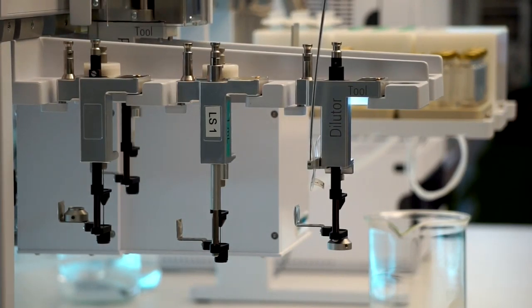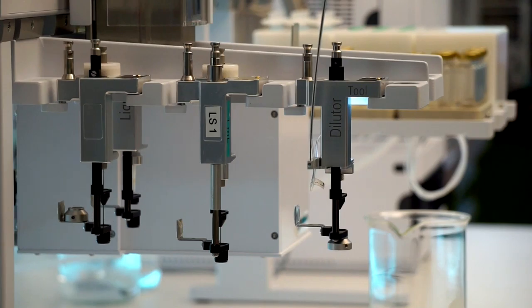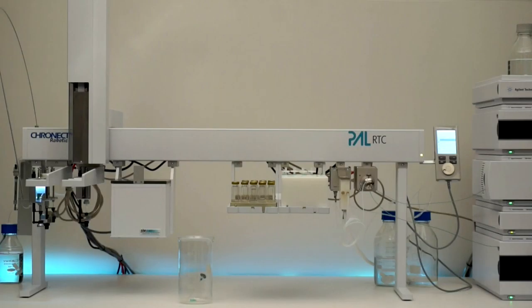The syringe tool is exchanged for the dilutor tool to return the 20 mL sample vial from the ultrasonic bath to its home position.